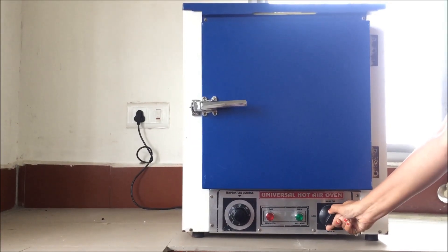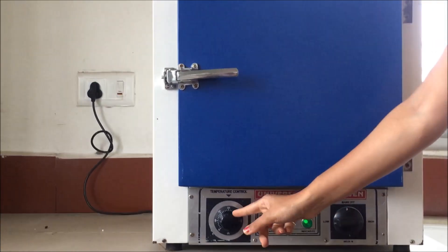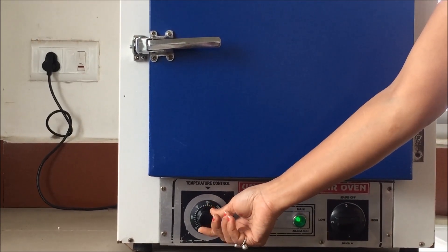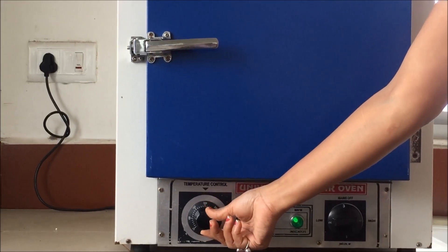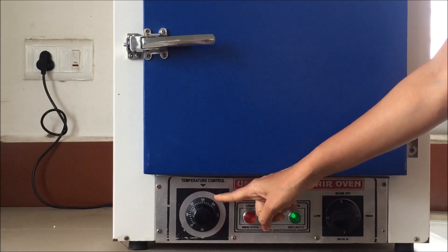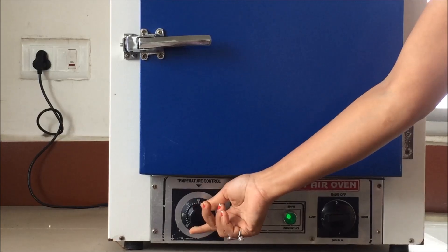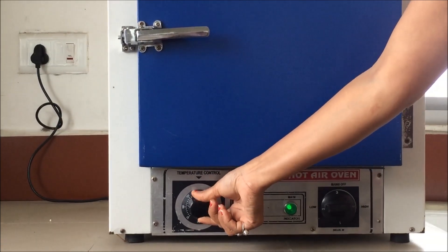This is the on-off knob. If you turn it right, the light will come on, which means the hot air oven has been initiated. And this is the temperature regulator which regulates the temperature. If you turn the knob towards the right side, it will increase the temperature gradually — this is the maximum point, and it depends upon the oven. If you turn the regulator to the left side or anti-clockwise, it will reduce the temperature accordingly.